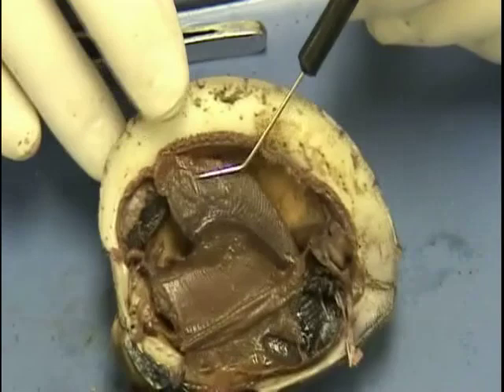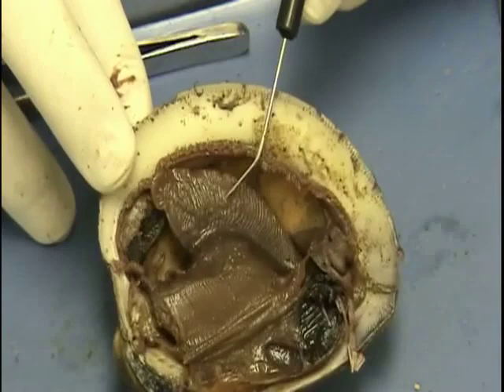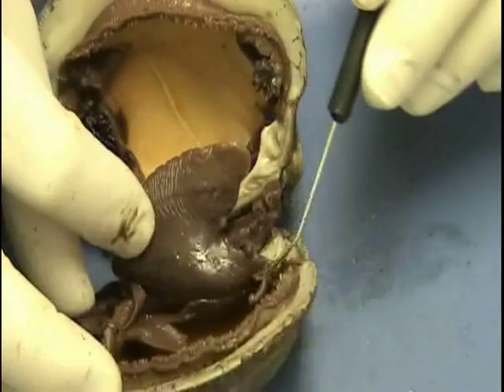Here's the foot — it's a muscular foot, very very muscular. This foot extends outside of the valve and is used for movement. It's very very hard and muscly. The gills we looked at here — some gills here. In fact, if we turn it around and look on the other side and move the foot, you can see that there are some gills right down here. I know it's kind of hard to see, but there's gills right down in there.